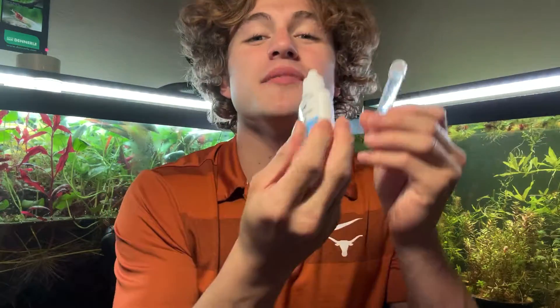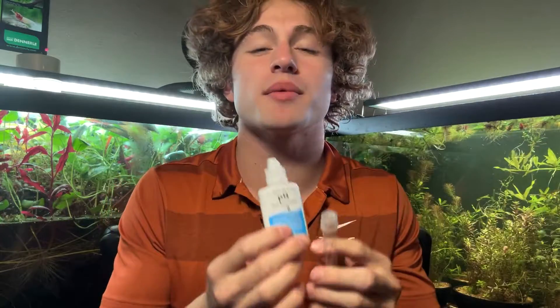If you're like me when I first started, you might not know what terms like nitrate and nitrite mean — don't worry, I'll explain those in this video. First off, we're going to measure pH. The pH determines how acidic or how alkaline your water is, which determines what type of fish you want to keep. If your water is very alkaline, you'll probably want to keep African cichlids or similar fish rather than very acidic-water fish.